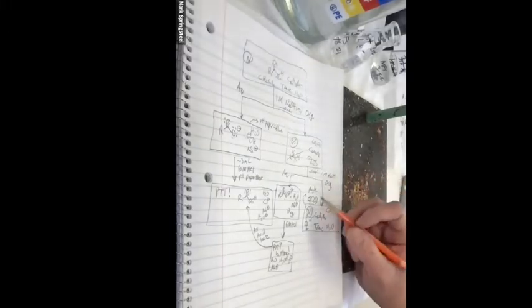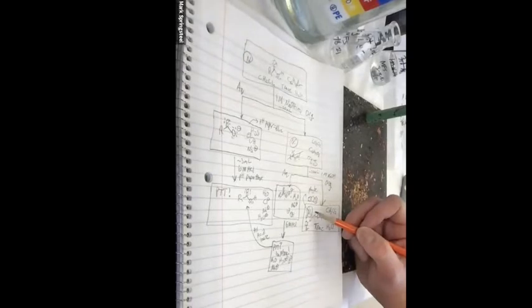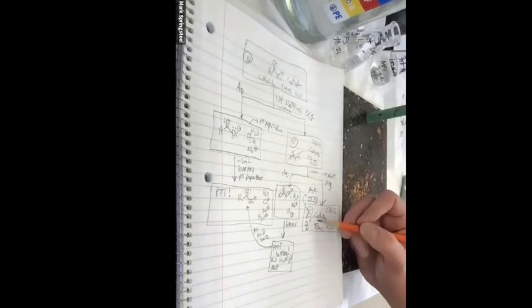Crystallization? Yes, because I have more of the neutral compound. It might be fluorene. I have about 4 times as much. So I'm going to treat this like it's an impure solid. But if I want to have them as an impure solid, what do I need to get rid of? You need to get rid of the water. I've got to get rid of the trace water, and what else? And then you've got to evaporate the methylene chloride. Yeah. Okay, so let's do it.